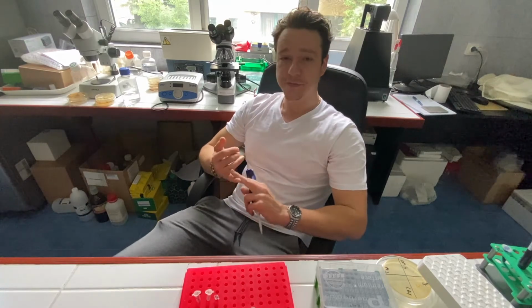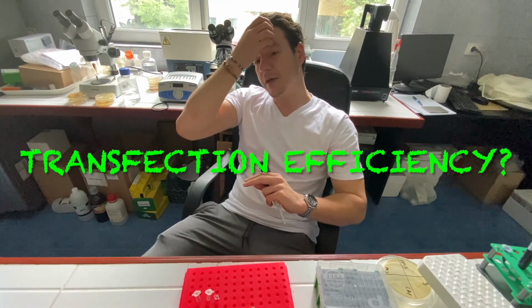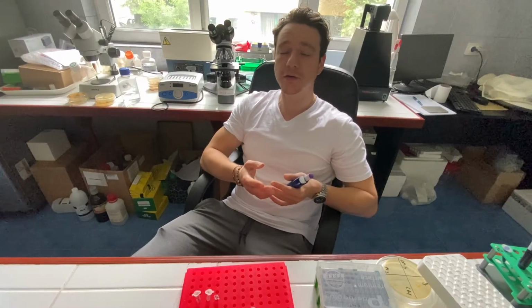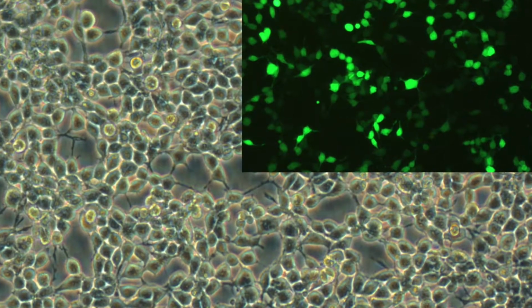Number one, the transfection efficiency of my vector variants, as it were. This means what percentage of cells were transfected using my vector. What percentage of cells are green and what percentage are not green for each variant.